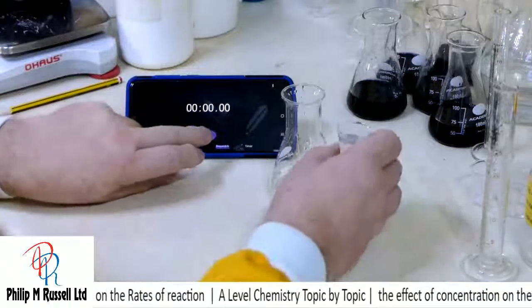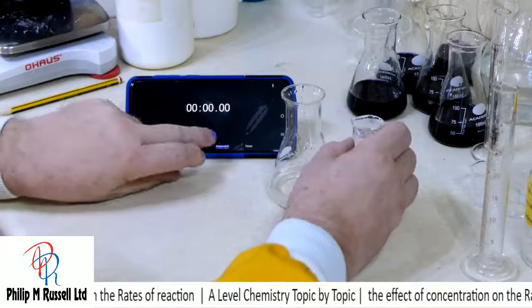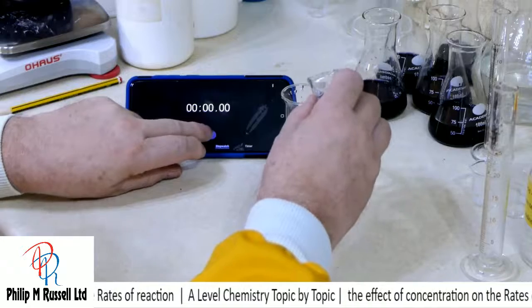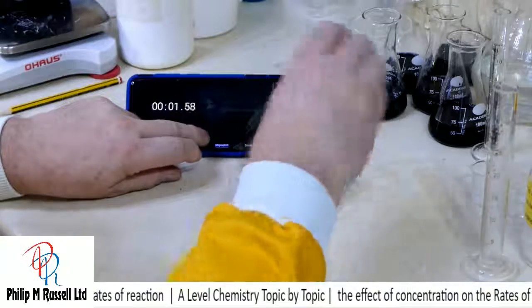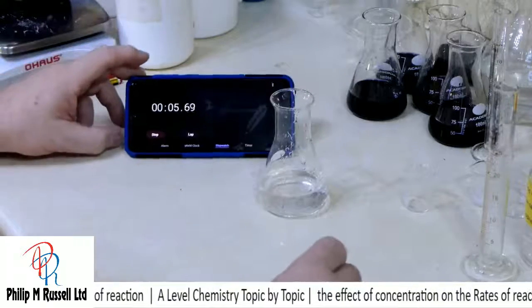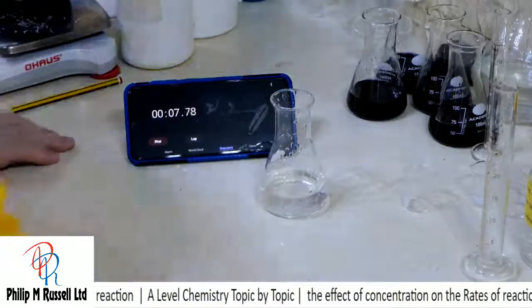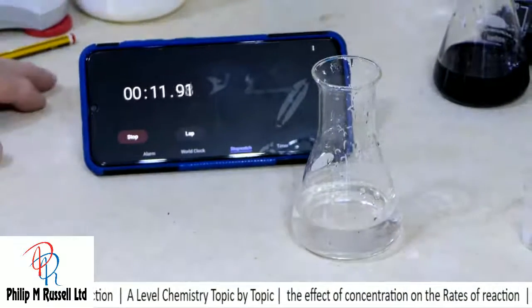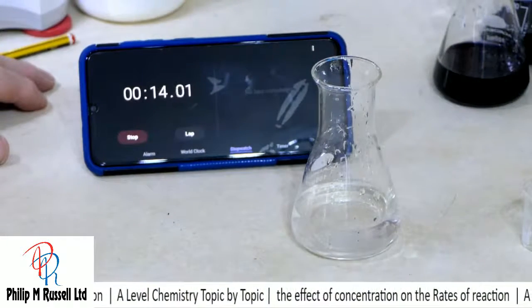Right, here we go. So we've got 30 mils of water in here this time. It's going to take longer, and here we go. Let's give it a really good mix. And we're looking for a time that's going to be greater than 13 seconds.